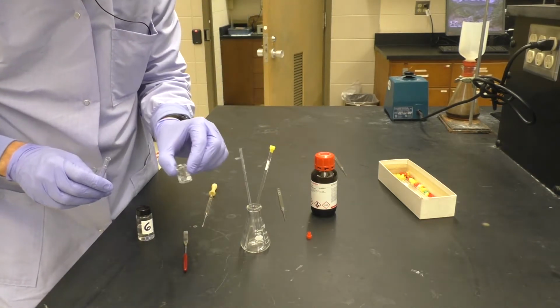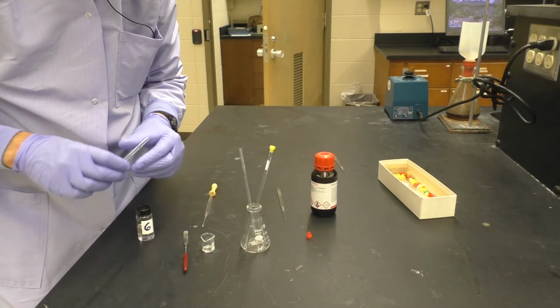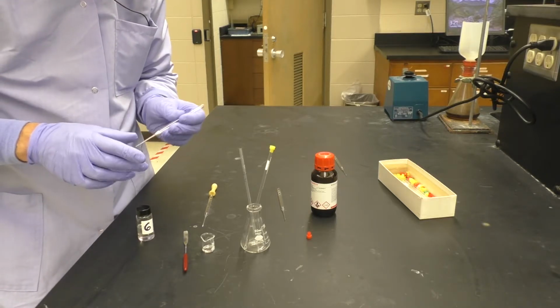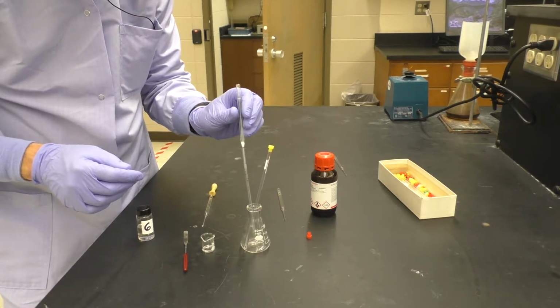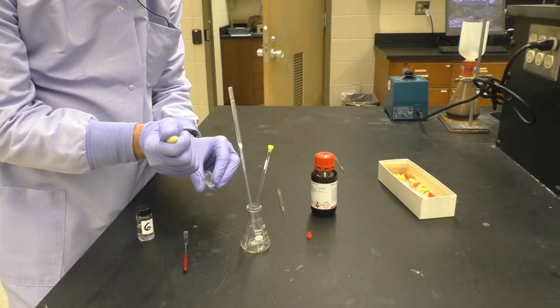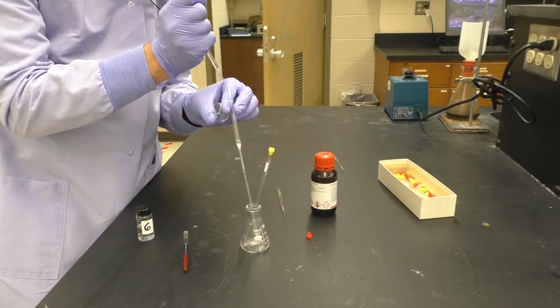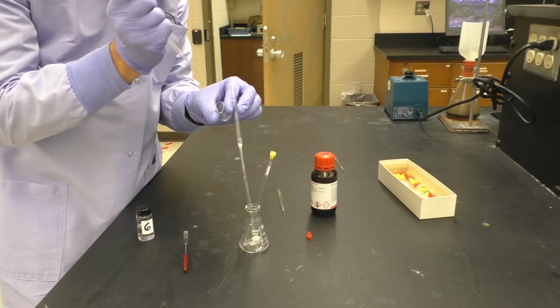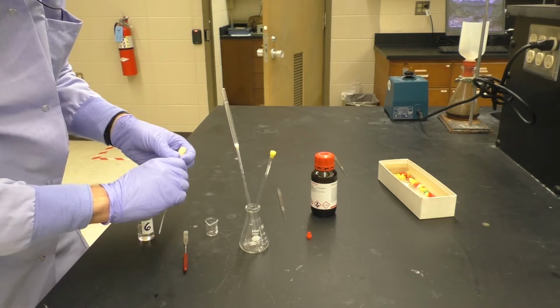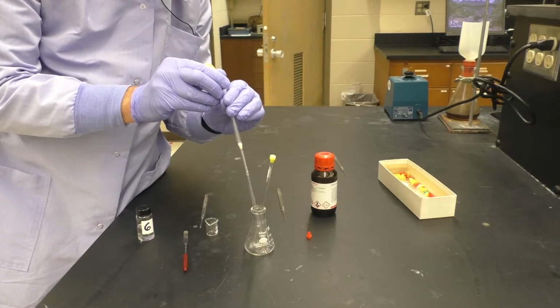Here we don't seem to quite have gotten everything soluble, and it's best to not have solid materials in your NMR tube. Sometimes you can, and the NMR instrument will still be able to handle it, but it's best not to. So we'll simply take our pipette filter, stick that down into the NMR tube. We'll take our sample, suck up everything that we can with the pipette, place it down through the pipette filter. That will then filter down through and into the material below. We can assist using the pipette bulb and push a little bit more.